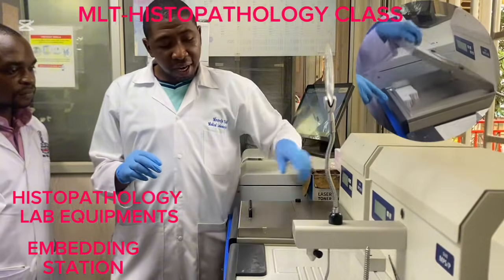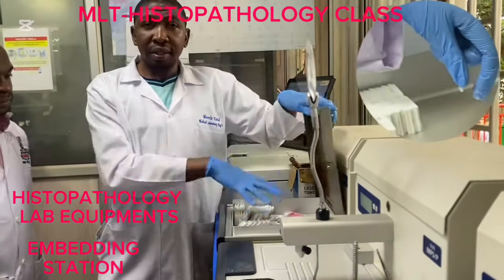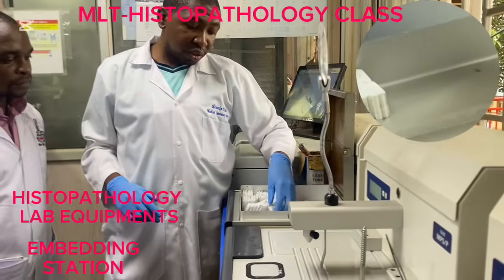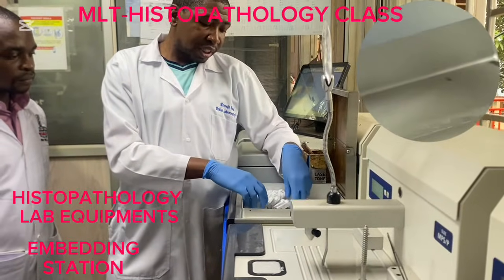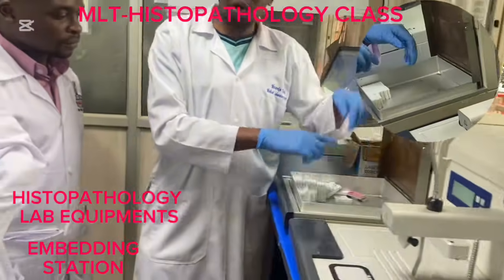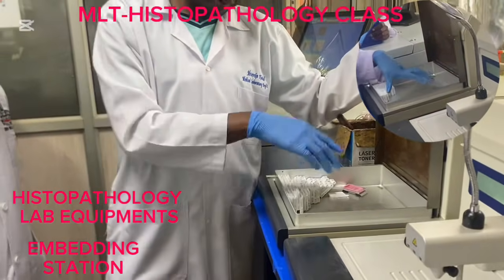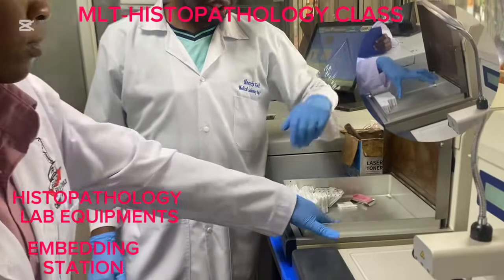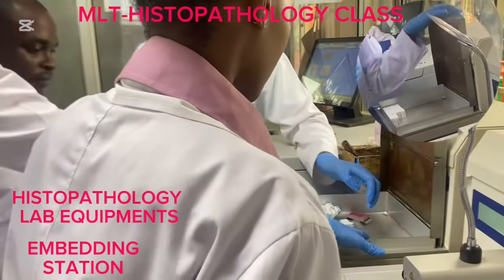Then number two, we have a tissue cassette compartment. Okay, so this is the compartment where we place our tissue cassettes with samples from the tissue processor. Let's have a feel.